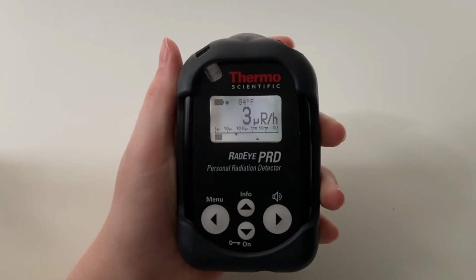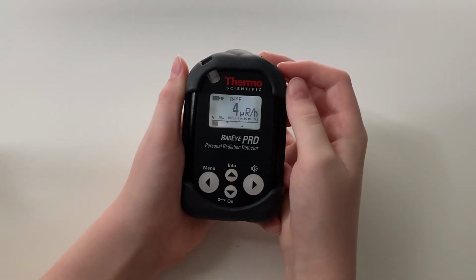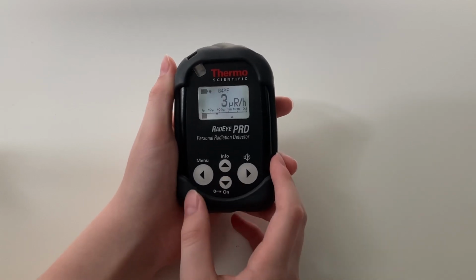Once your instrument is set up, it will display the current temperature. Pressing any button will result in a short audible pulse and illumination of the display. To save on battery power, the backlight will turn off after a default of 10 seconds.